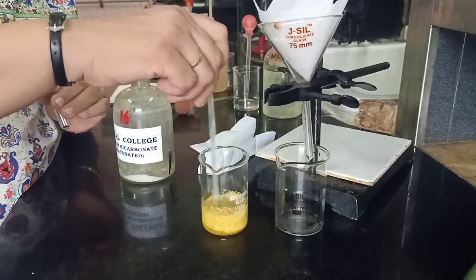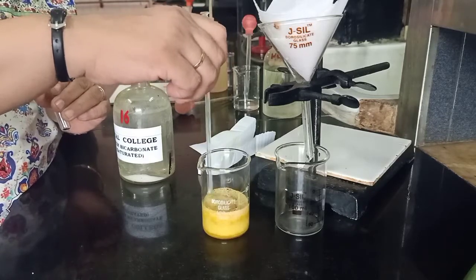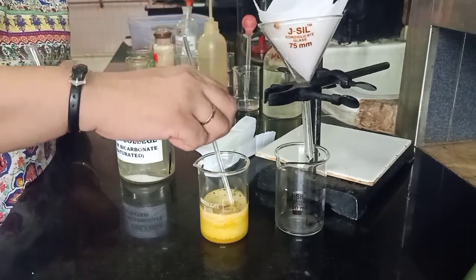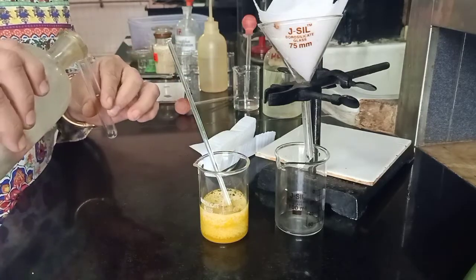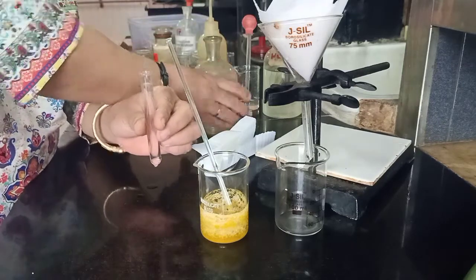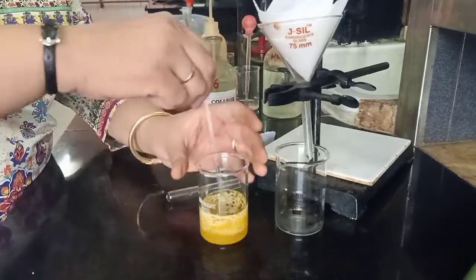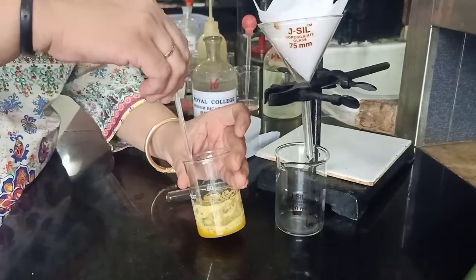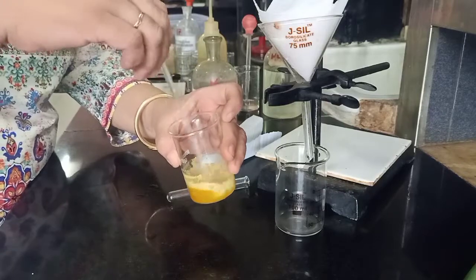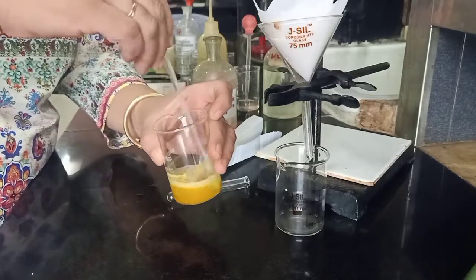Stir it. The brisk effervescence is due to the evolving carbon dioxide. We will add another test tube of bicarbonate to ensure that the acid is completely dissolved. We do not want any traces of the acid to contaminate our other component, which is the base. After adding about 15 to 20 ml of the separating agent, we need to stir for a good three to five minutes to ensure the removal of all traces of acid.